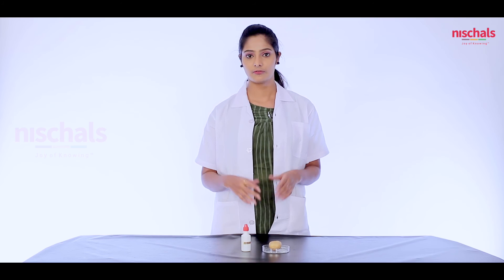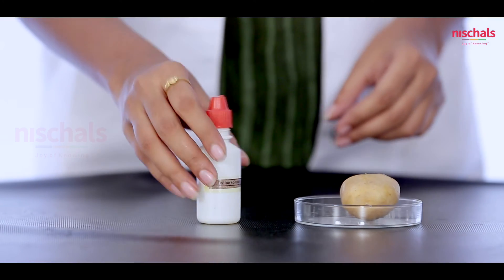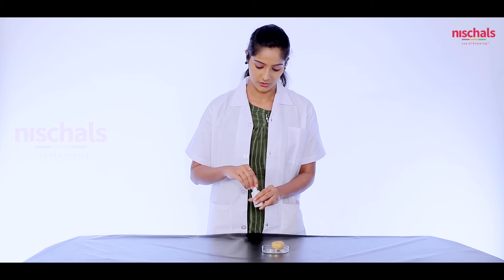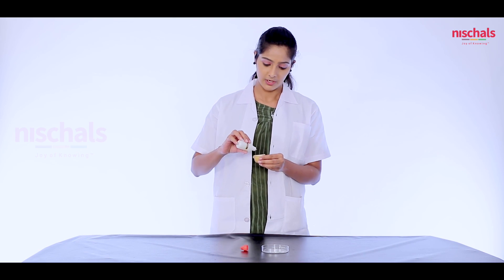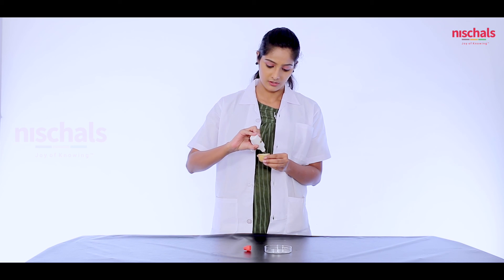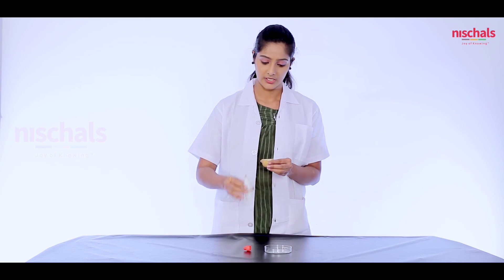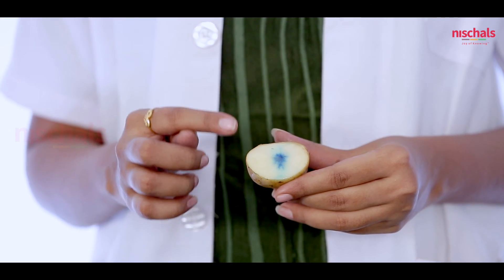Now we will do a test for the presence of starch. For that we need a potato and iodine solution. We add a few drops of iodine solution onto the potato. We can observe a change in color, which proves the presence of starch in the potato.